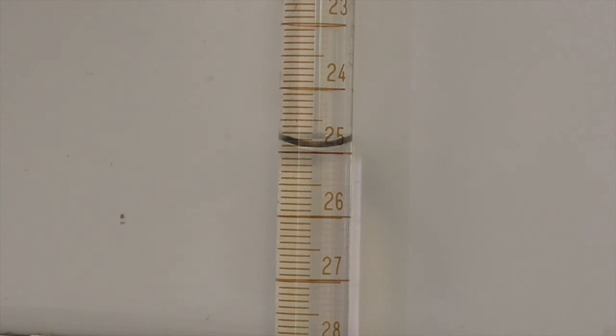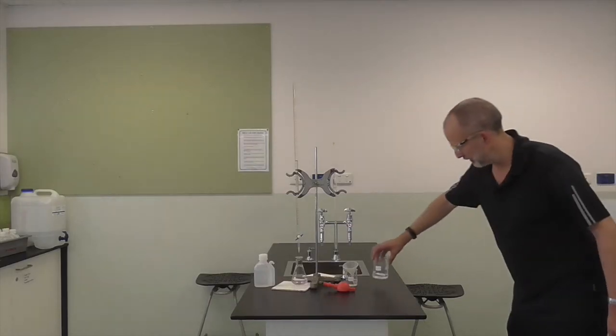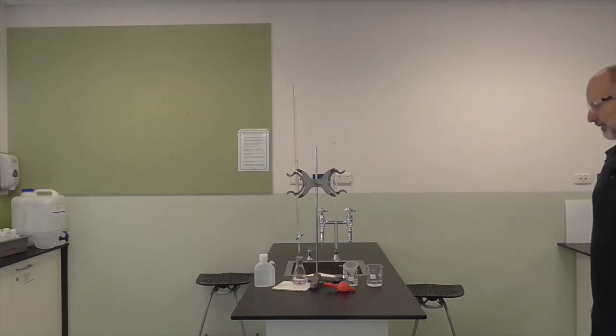Read off the final value from the burette. In this case 24.9 milliliters. Today on Flipping Science we did an example titration. That's the Flipping Science today. See ya!